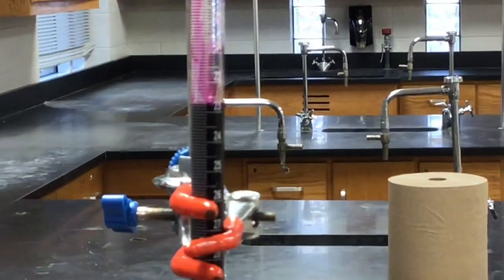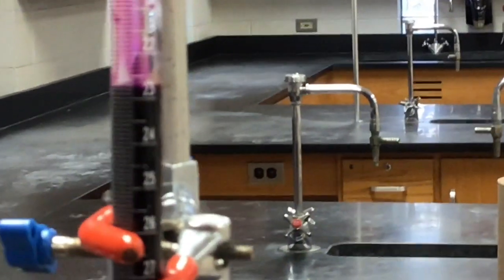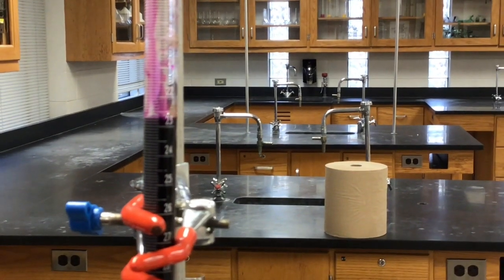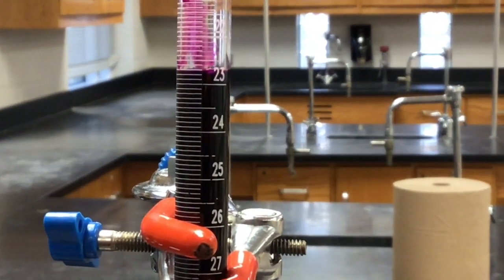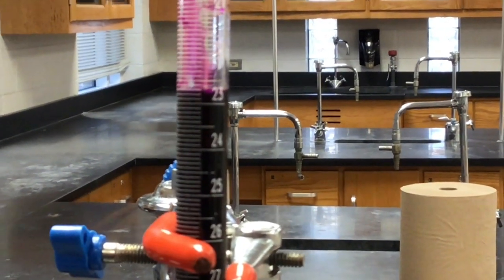We're close to the clamp. Is it focusing on the clamp? Well, it's focusing on something else. I'll just move a little closer to it. Can raise it up. Oh, there we go. Just caught something else.